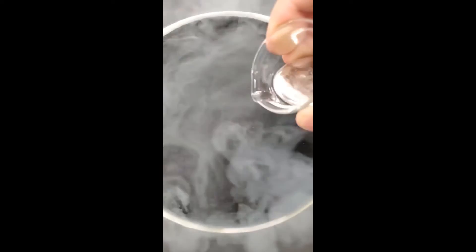To do this, I just have to add some liquid nitrogen to a dish and wait for it all to cool down. Now it looks like it's good to go, and I can pour in some of the mercury.